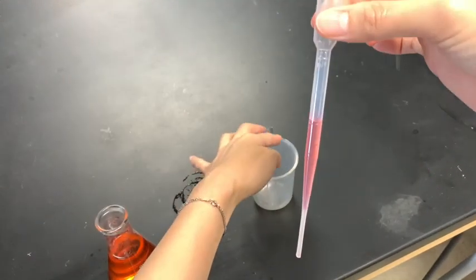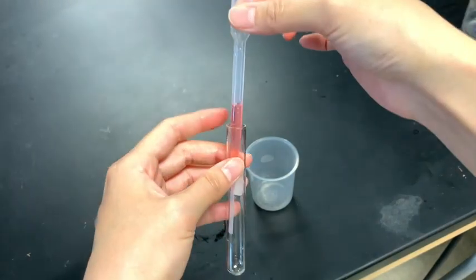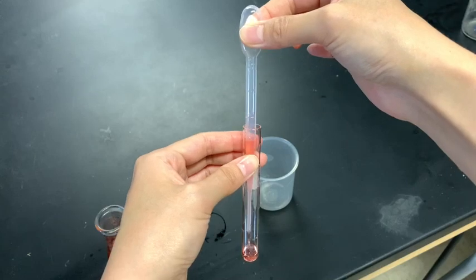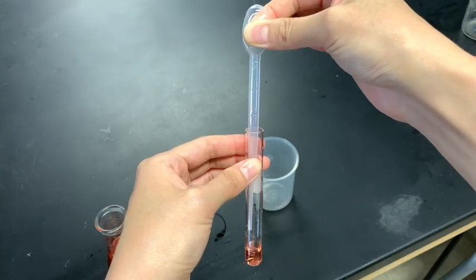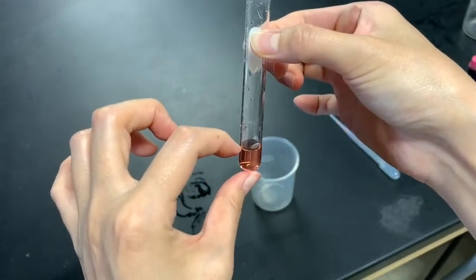Now next, you're going to take a clean test tube, place the tip of the pipette into the test tube, then apply gentle pressure on the bulb to slowly dispense the solution. So this is about 1 milliliter of solution.